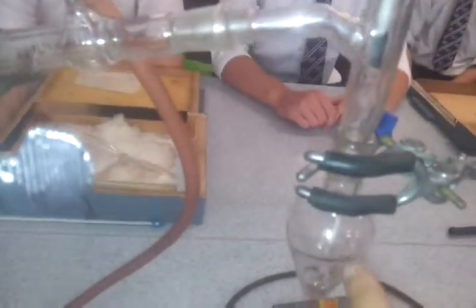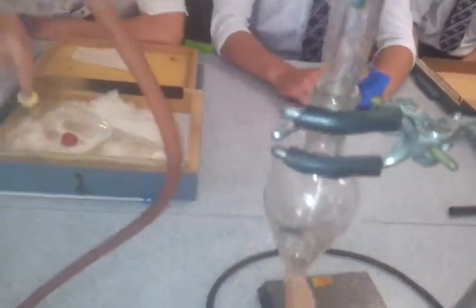Okay, what we're going to look at here are these two systems. This one here is called distillation, and we've got a condenser connected by a little T-junction to a pear or teardrop shaped flask, which would be heated by a Bunsen burner. This one here is called reflux, and reflux doesn't have all that set up. It's got the heat source, Bunsen burner, the flask, and then just a condenser.